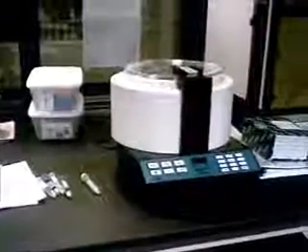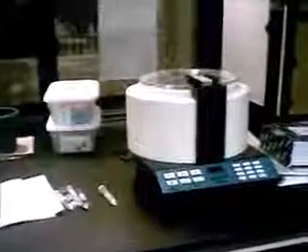Hello. This is a quick instructional video on how to use a centrifuge. A centrifuge is a laboratory equipment, such as seen here, that is used to simulate hypergravity on certain objects and also to separate mass from liquids.